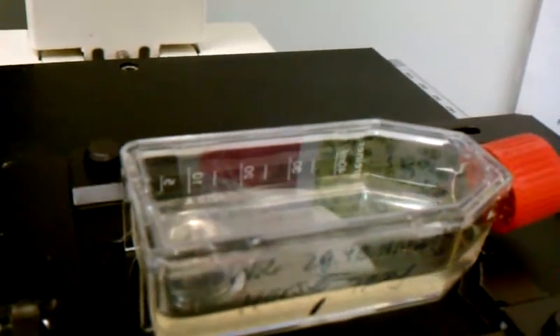Oh, look, another rosette. A few. They're just moving. They stay on the go. They're really busy. You can focus in between them and in and out of them. You see the one floating on top of them. Like, there's different layers of flask. I move the flask up and down and move the microscope really any way I want to get a good focus on them. And time for sample 2.